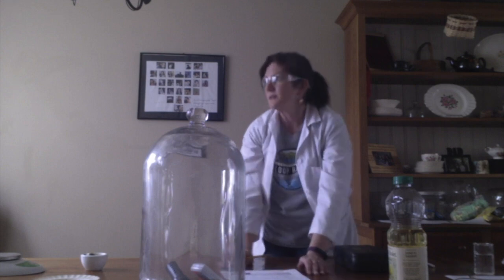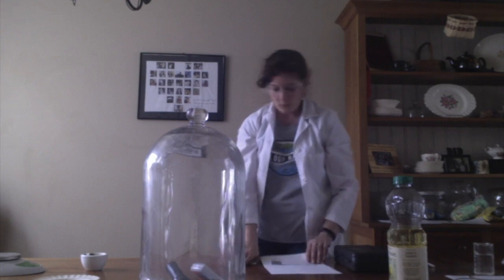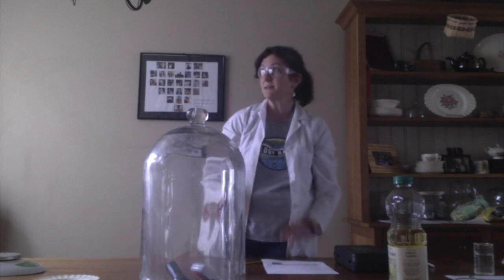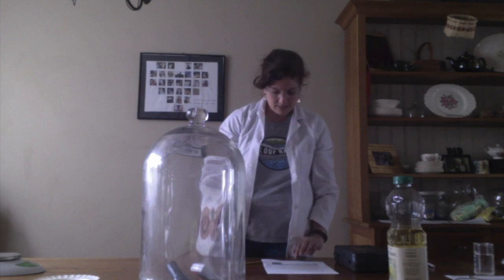All right. So now, Lizzie, we need to have our oil here. We're going to quickly get it under that glass container, so I rely on your lightning quick reflexes. All right. So we need to set it on fire and then put it under.